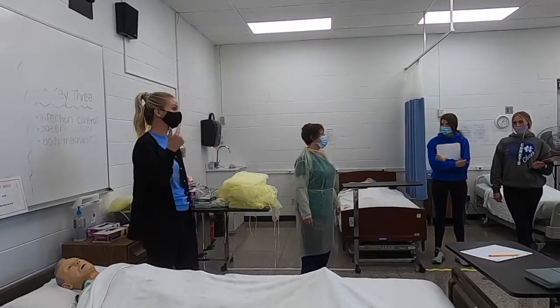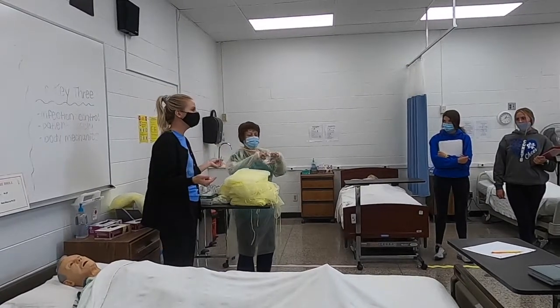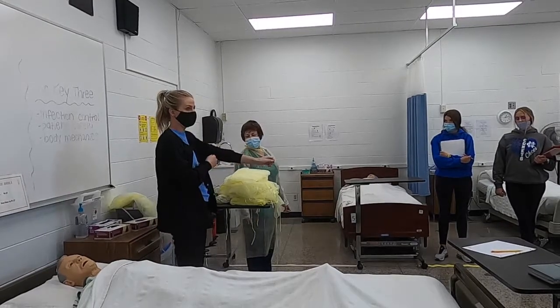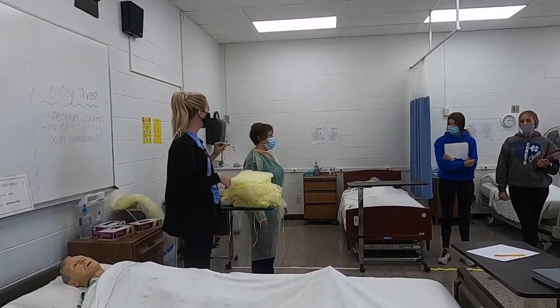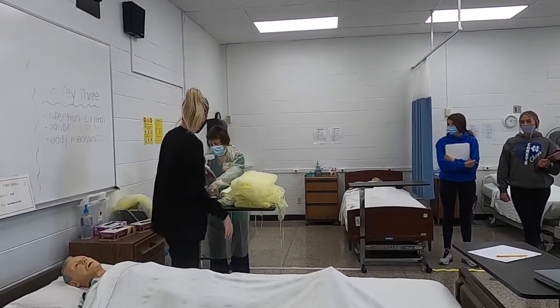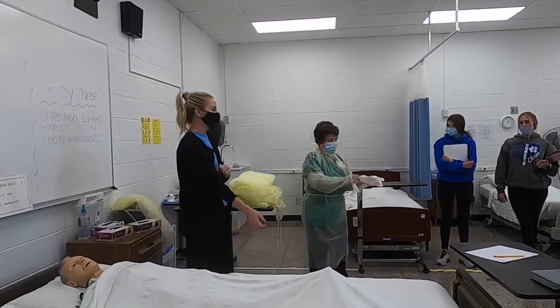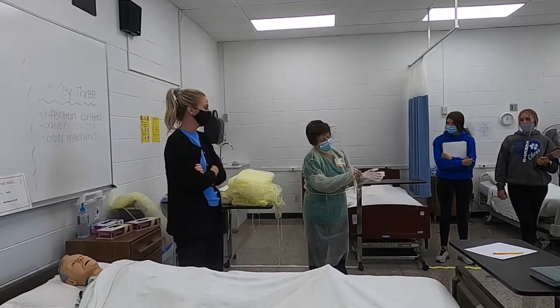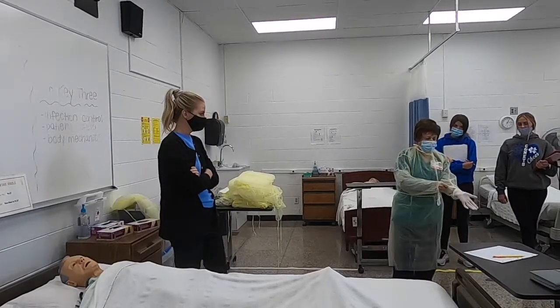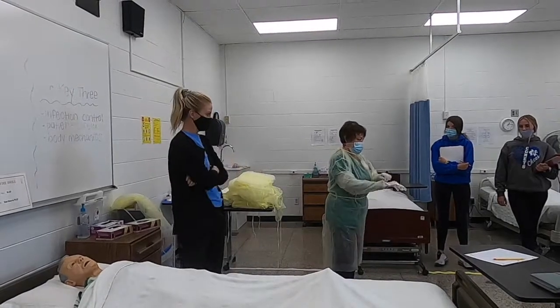So gown, mask, then what? Goggles. If you need them. A lot of isolation precautions you don't, but you may, so we like to throw that in the order, okay? Gown, mask, goggles, and then gloves. So Jill is gonna pick her glove size. Put them on. We all learned how to put on and take off gloves when we did the little catch-up activity. See, I've got that way down in there, but I can always pull back. And she's not exposed. She has some wiggle room there.